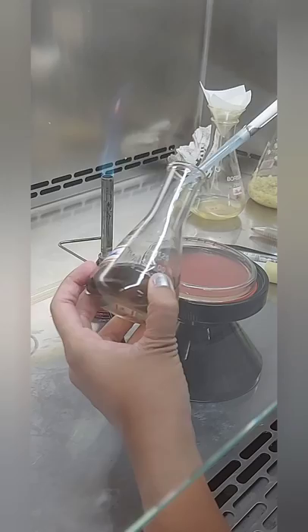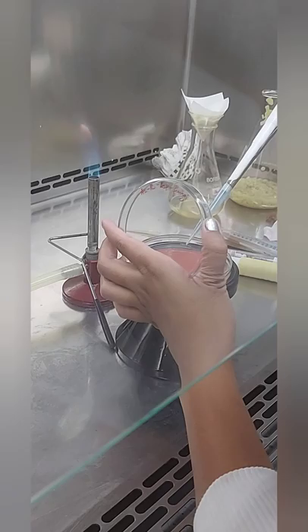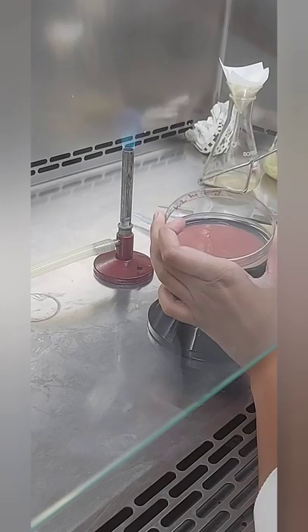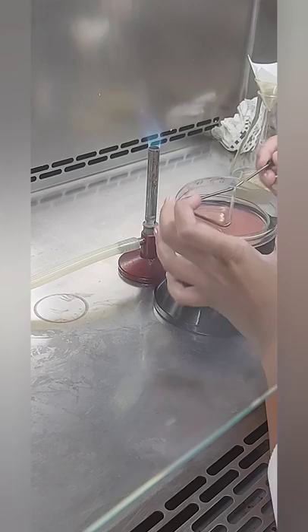The spore inoculum is inoculated into the potato dextrose agar media. You can use whichever fungal or bacterial species you are working with and choose the media accordingly. Then we spread it evenly across the plate using a sterile L-shaped glass rod, making sure the spreading is done evenly around the entire plate.